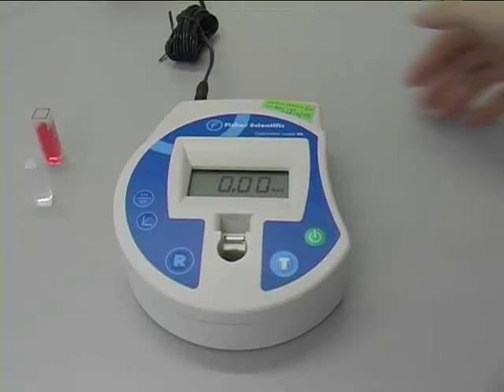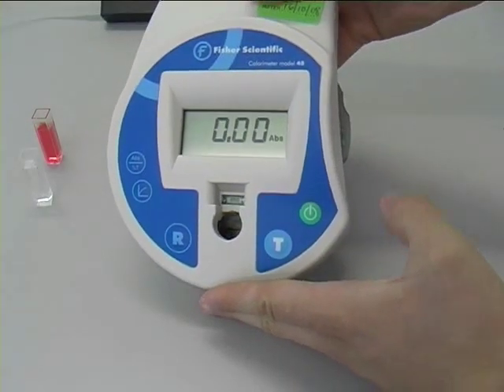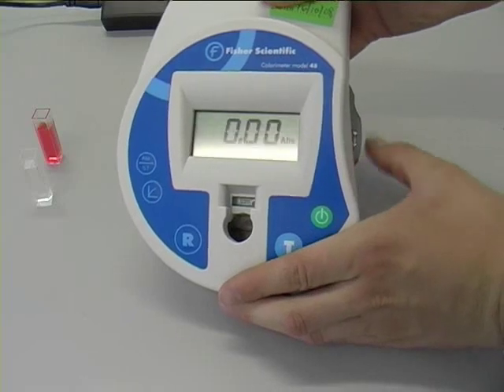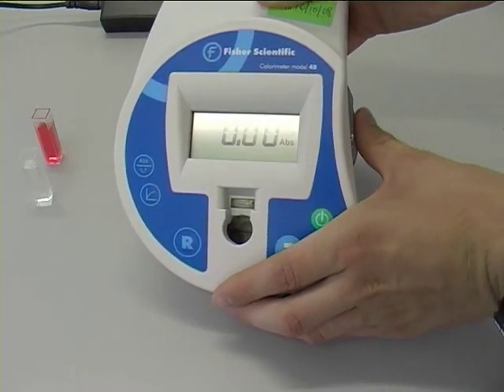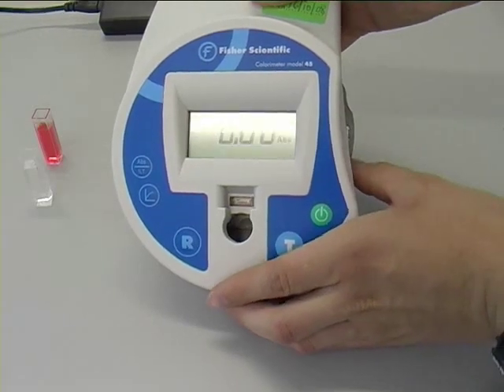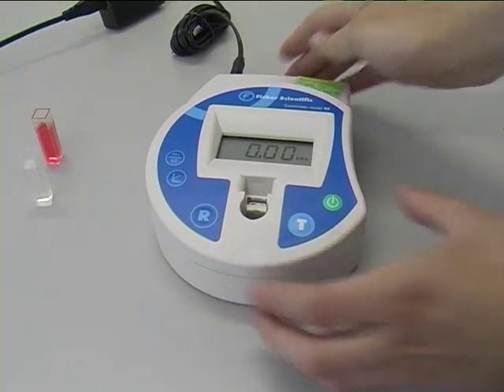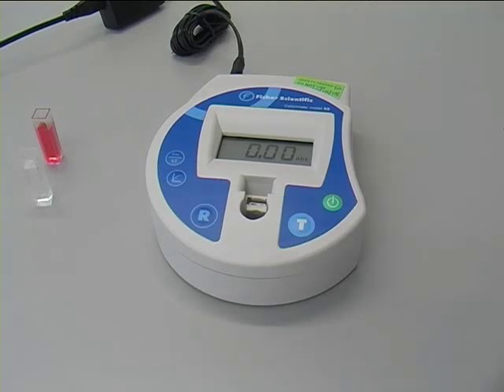Colourimeters are instruments that are used to measure the absorbance of samples. The wavelength of the light passed through the sample is controlled by a set of filters, which are an integral part of the instrument. The filter to be used is set using the dial to the side of the instrument. Between the cuvette holder and the digital display, a small window shows the colour and wavelength of the selected filter.